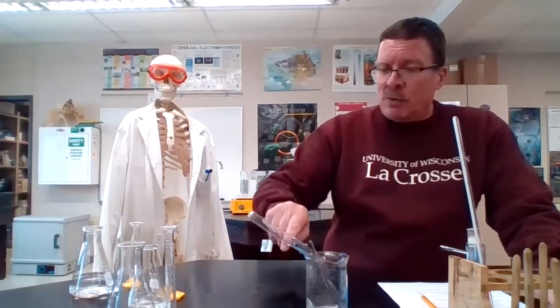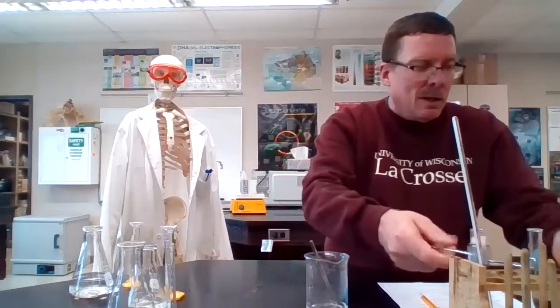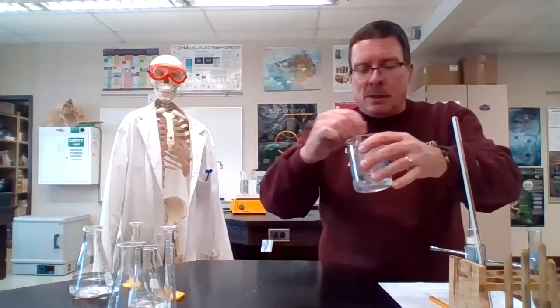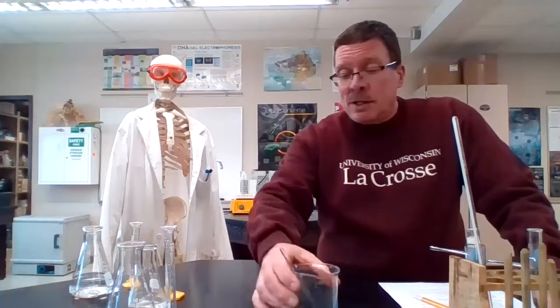We have the 45-degree stuff. I'll be back. Okay, we're back. We're at the 45-degree extravaganza again before it cools off too much. There goes my B. Here's my A and C. Bam. Timer, stir. What do we want to beat? We want to beat 47 seconds. Again, higher kinetic energy. Bam. We were at 10 seconds. That's speedy.